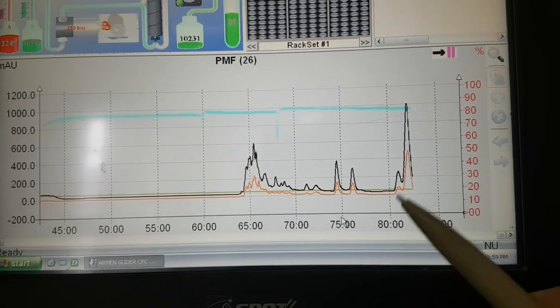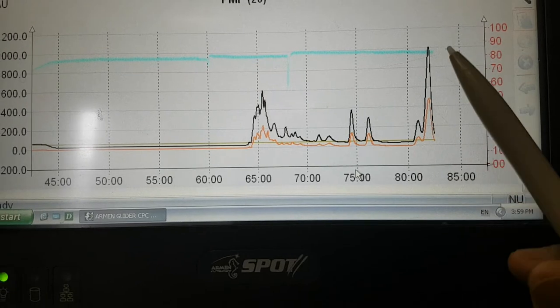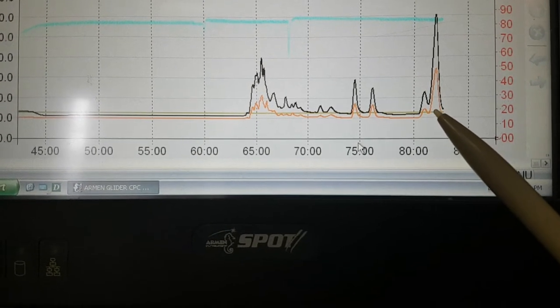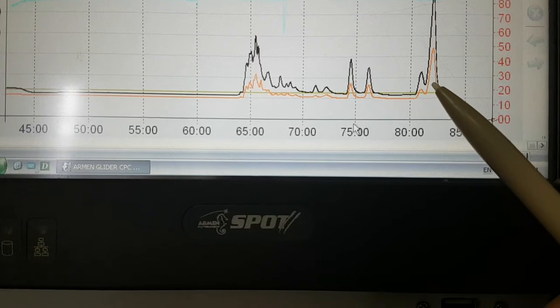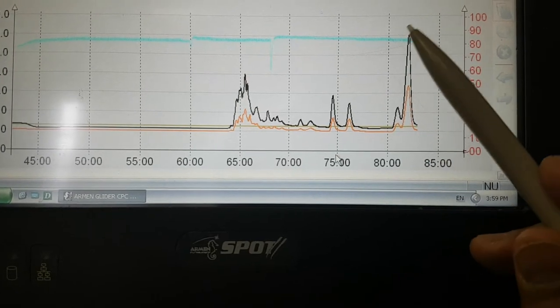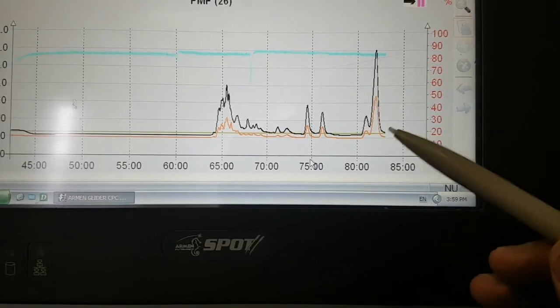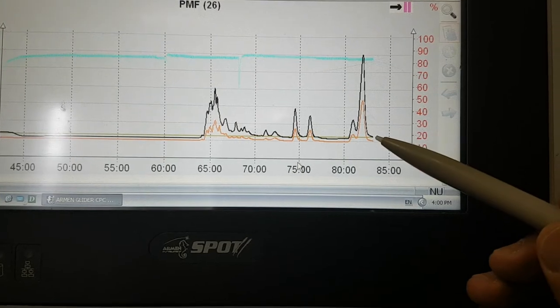Well, during this method, as you can see here, we isolated this one, but this one is not. They are not well separated, because this point must reach the baseline here, then go up, but it doesn't come down to the bottom. For this reason, for this part, we need to search for another method, either using a low elution system, or we can even change the column, maybe.